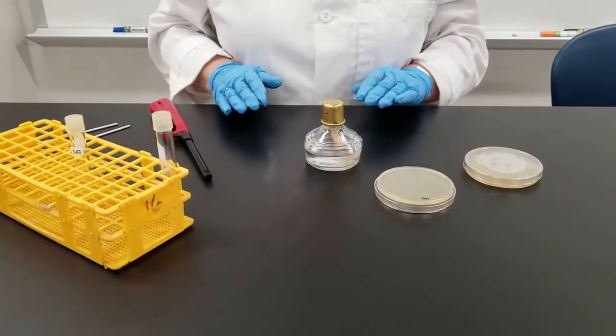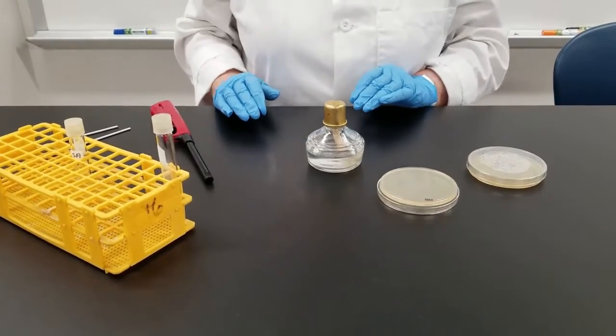Okay, today I'm going to show you some different transfer techniques that we use in microbiology.